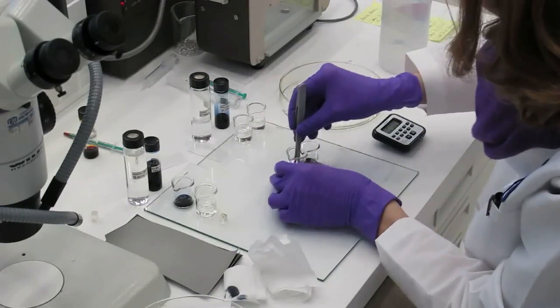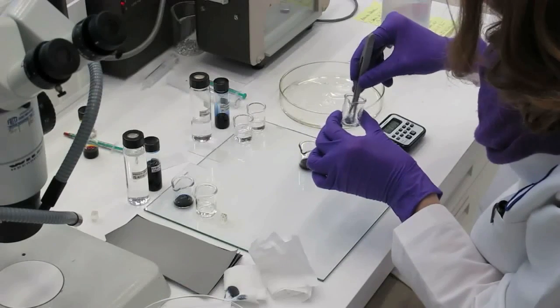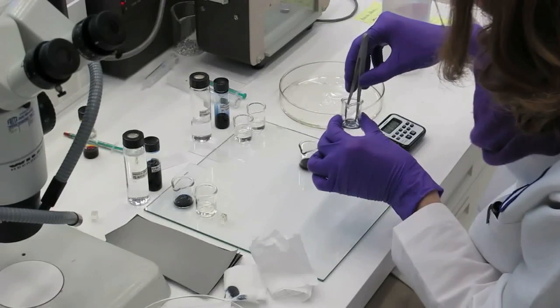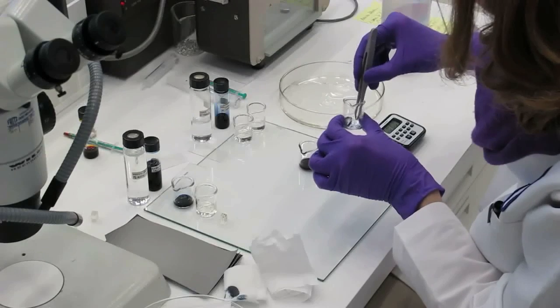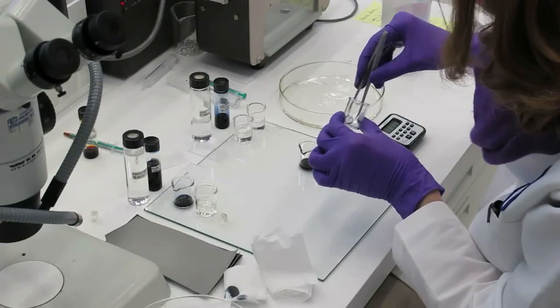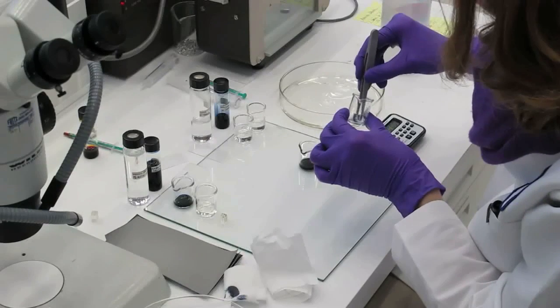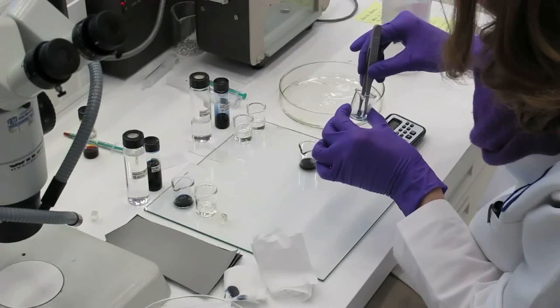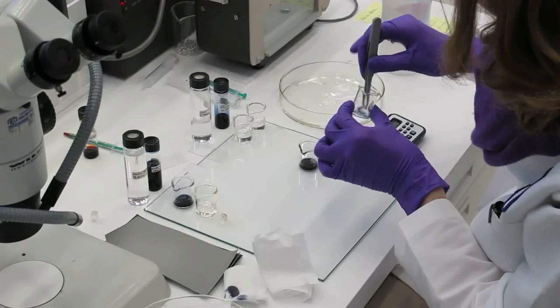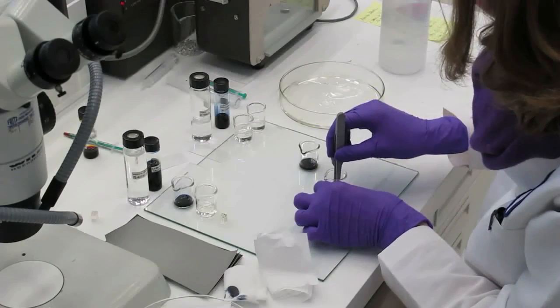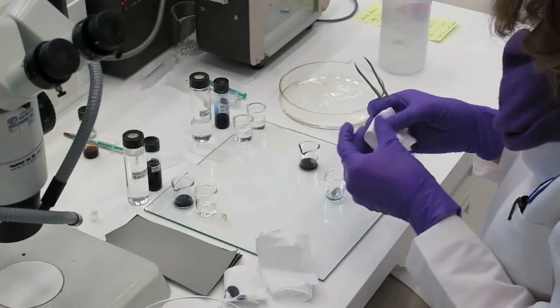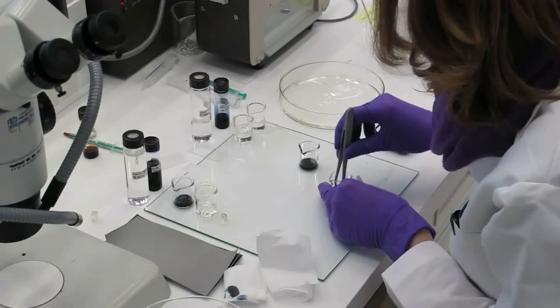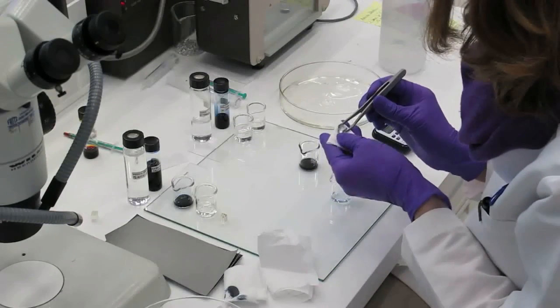You can use a squirt bottle for rinsing. The sample is now placed in several dishes filled with the same solvent that was used for the saturation process before staining. The cross-section is gently moved with some tweezers and rinsed in these solutions for as long as it is giving off some stain. If the rinsing solution becomes coloured, it should be replaced by a fresh one. With Sudan black staining, it is very important that both the saturation process and the rinsing are done very thoroughly, as otherwise a meaningful interpretation of the results may become very difficult, if not impossible.